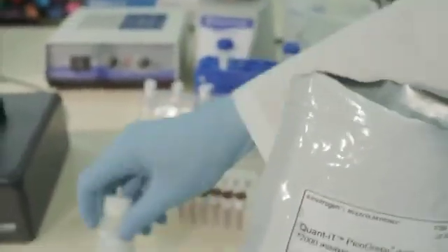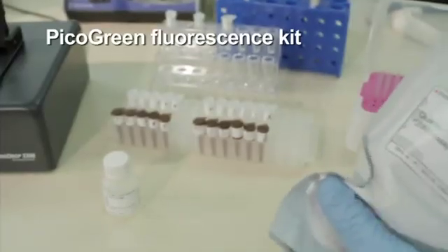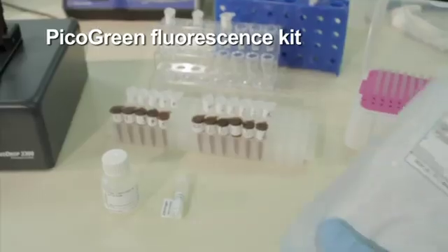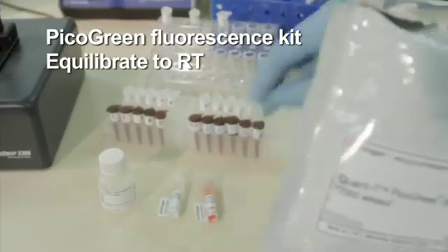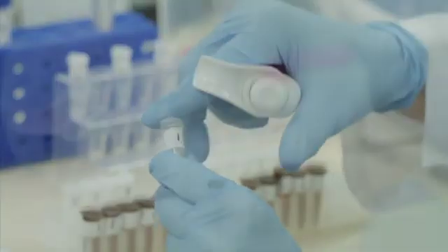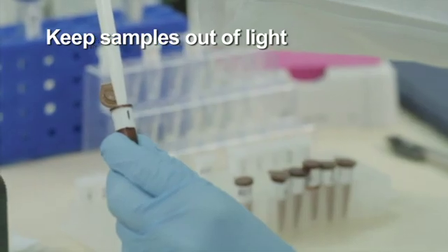To demonstrate high-sensitivity microvolume nucleic acid quantitation using the Nanodrop-3300, a pico-green fluorescence kit is used. To begin, equilibrate the kit standards and all nucleic acid samples to room temperature. Fluorescent samples are light-sensitive and should be kept in amber or aluminum-wrapped tubes.